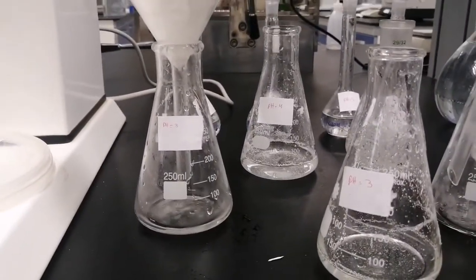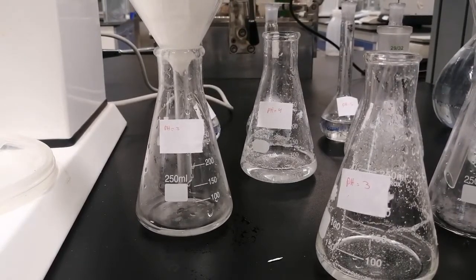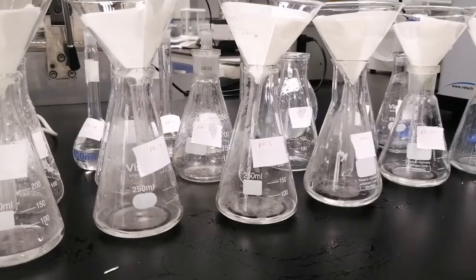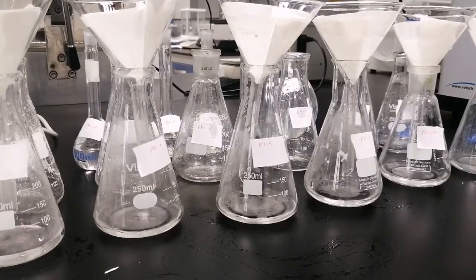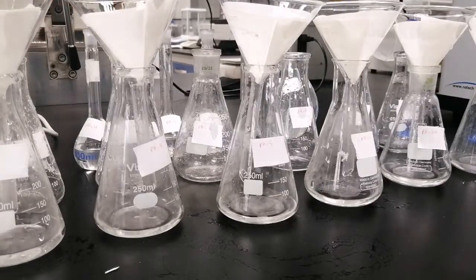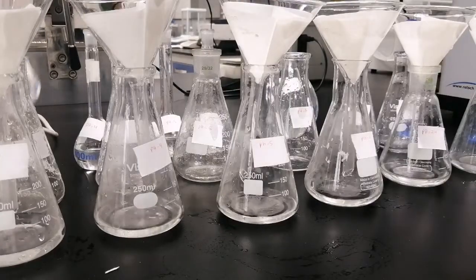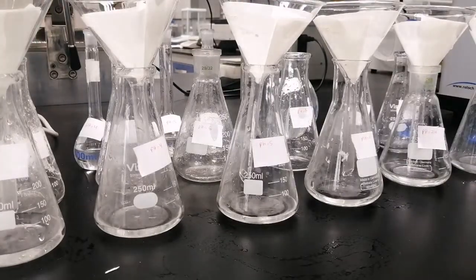If we dilute it with sodium hydroxide, we will mix the buffer and the sodium hydroxide as a blank in order to subtract the effect of sodium hydroxide or the buffer from measuring the absorbance of mefenamic acid in the solution. Now, as you can see, each solution is being filtered. We will take around 3-5 ml of each solution in order to measure the absorbance, and we will keep the buffer solutions, pH 3, pH 4, that have been prepared first, in order to use them as blanks.